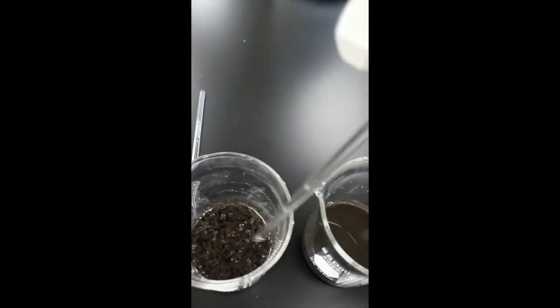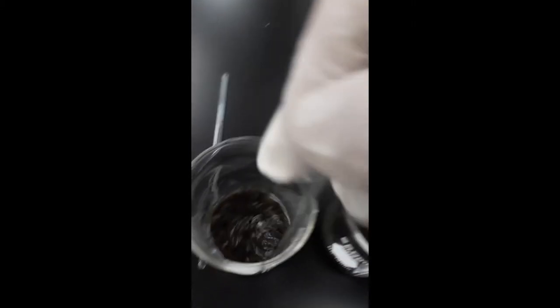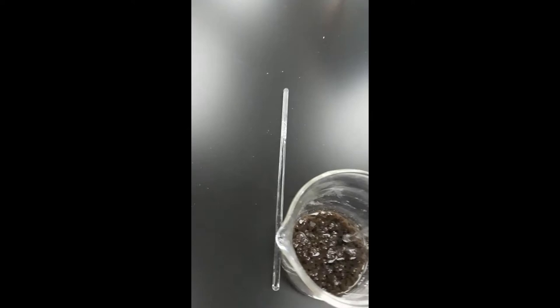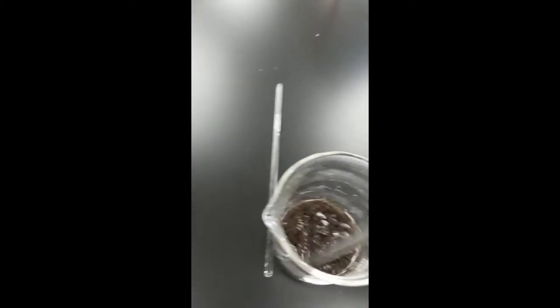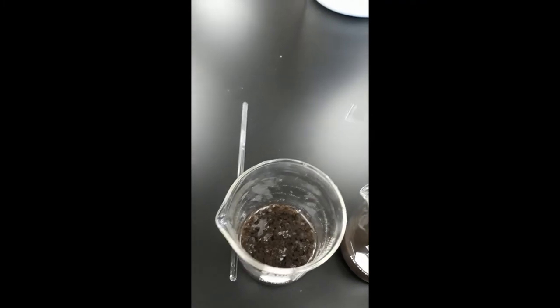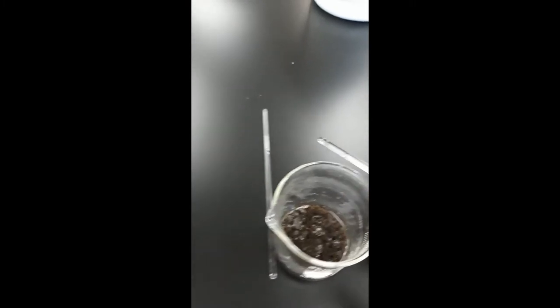What we're going to do is pour this now into the filter.